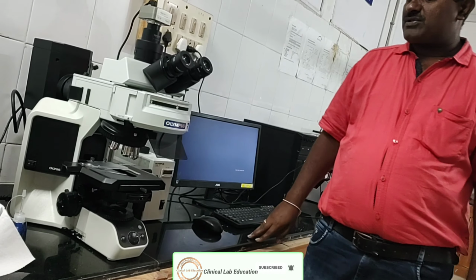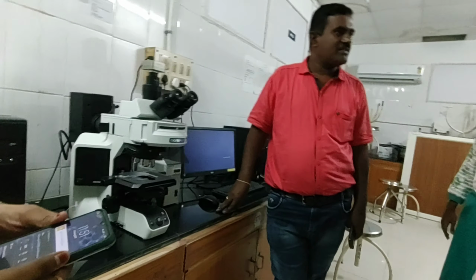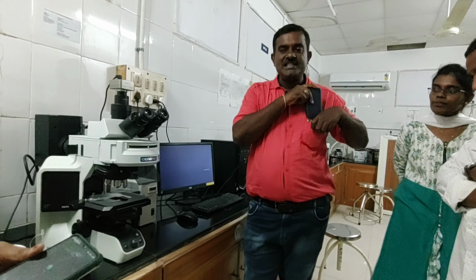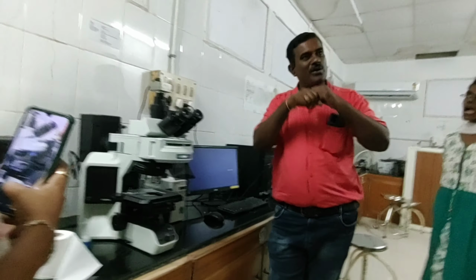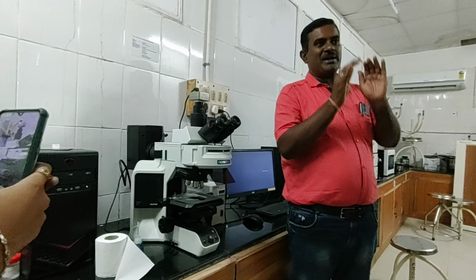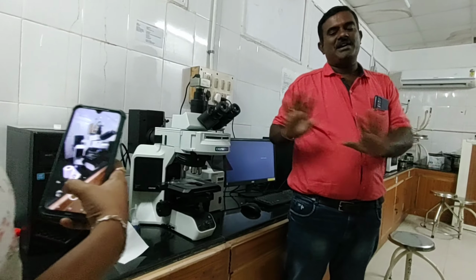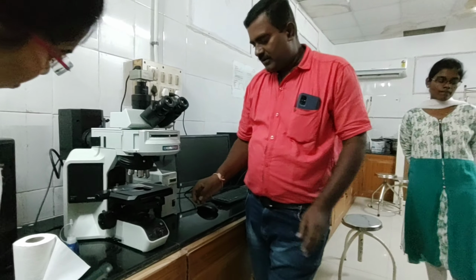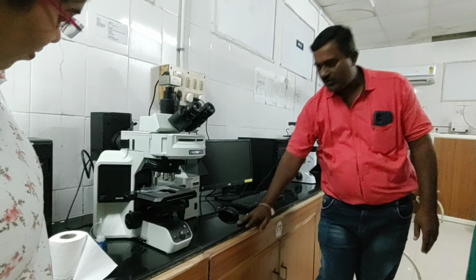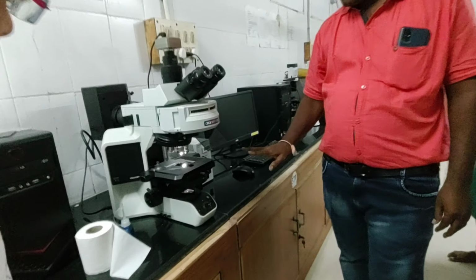So this is the fluorescent microscope, which has different types of light, and as well as we can see here bright field, dark field, fluorescence. So this is one, we can go with any type of microscope. Some microscope is only for the dark field, some microscope is only for the bright field, some microscope is for fluorescence, but this is for all. So if you want to go for fluorescence, we have to say, now we are checking for only fluorescence.